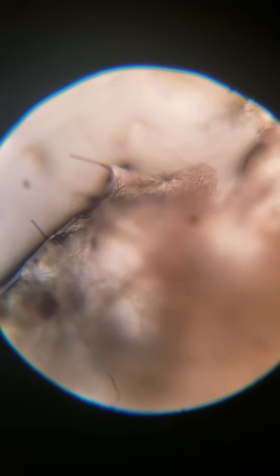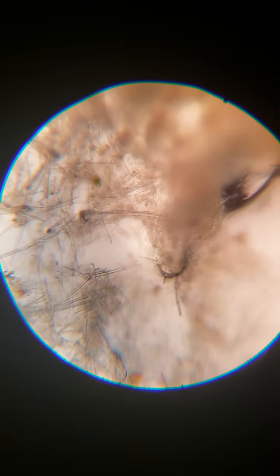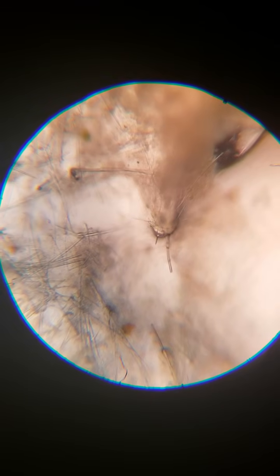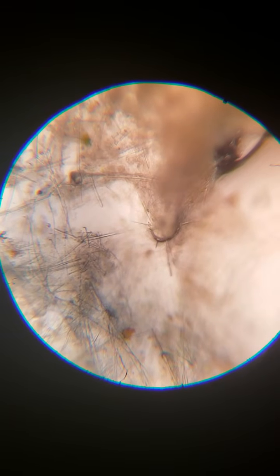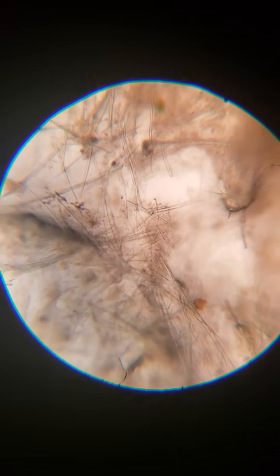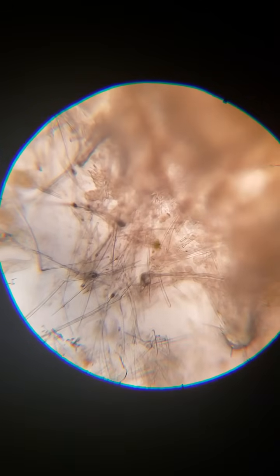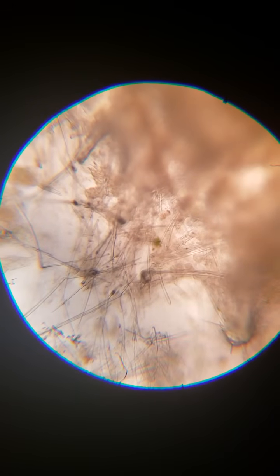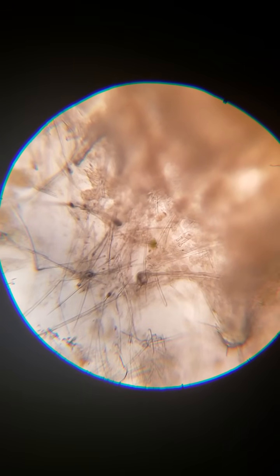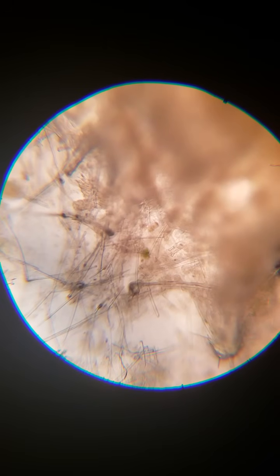There's the little feelers and sensors that they have out on the edge, which tell them where they're getting nutrients from and where to grow. The pocketing that goes on, like here's a pore, things get stuck in that channel there between all those little rigid things, and that orange there is actually food that it's eating. And then here are two of those gemmules or spinules, I've also seen them called.